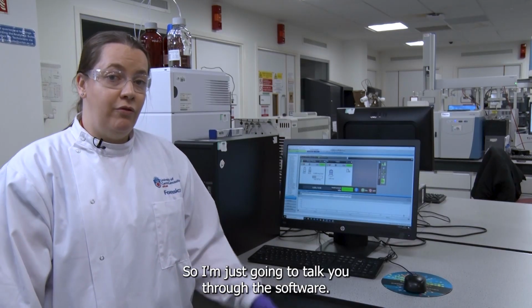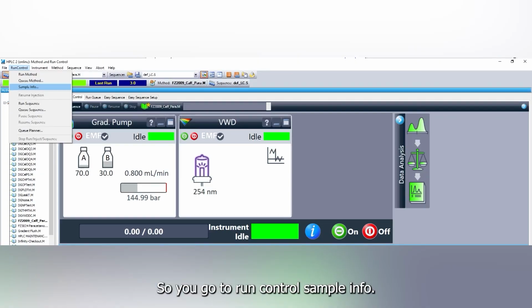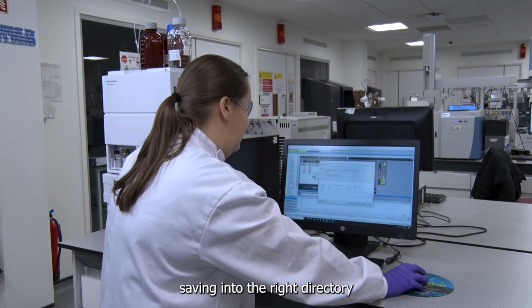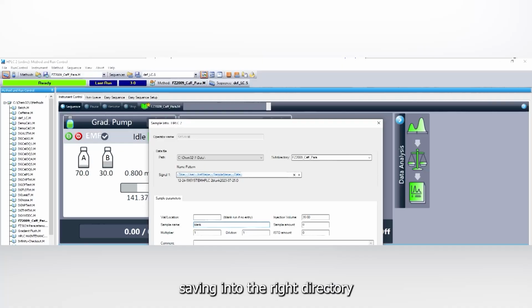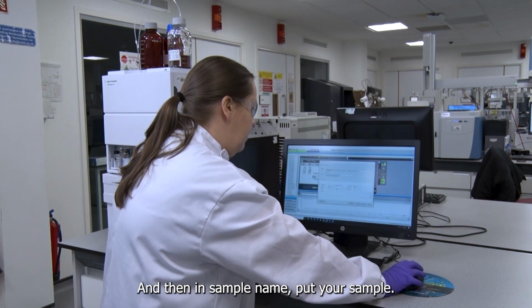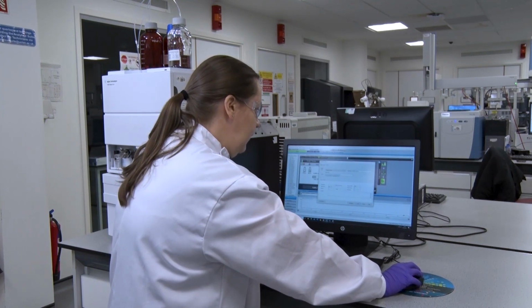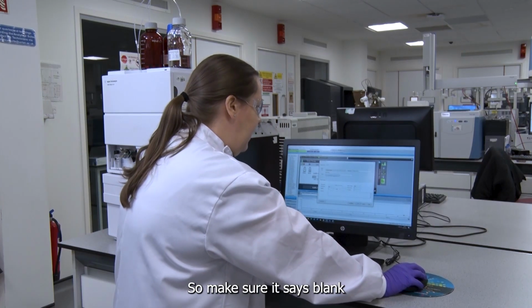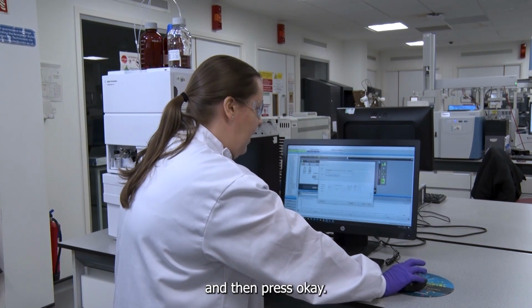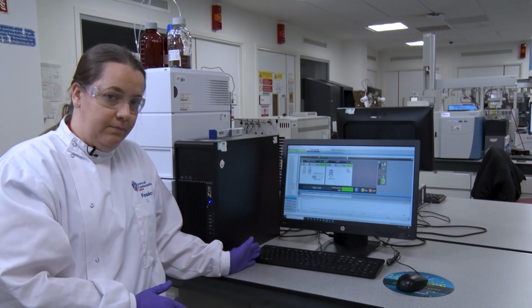So I'm just going to talk you through the software. You go to Run Control, Sample Info, check that it's saving into the right directory, which will be your module, and then in sample name put your sample. So the first one is a blank, so make sure it says blank and then press OK. This isn't going to start until you inject a sample.